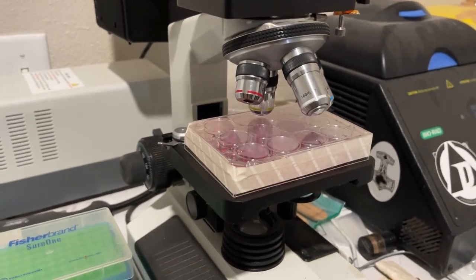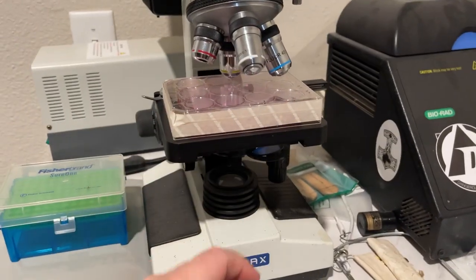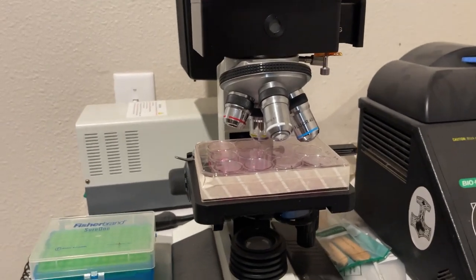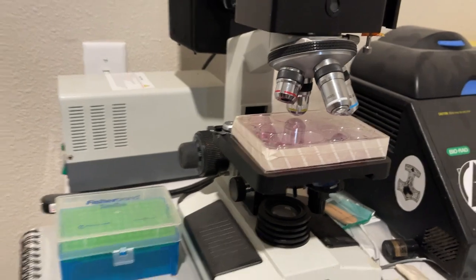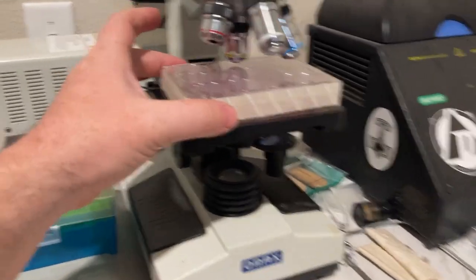These are genetically modified using this. If they've been successfully genetically modified, they'll be green and fluorescent. But I don't have an inverted fluorescent microscope. I have a regular fluorescent microscope. The other issue is with a 12-well plate, the eyepiece doesn't quite fit in it.